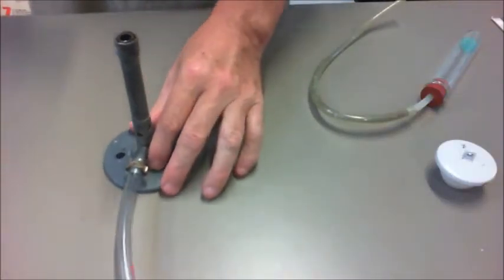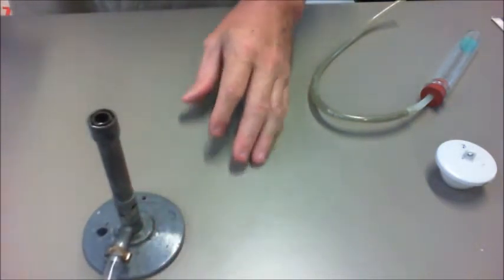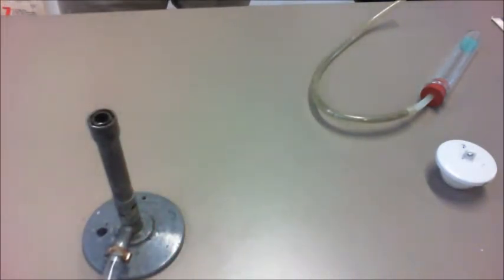Welcome to the experiment today, which is an example of a decomposition reaction. A decomposition reaction involves the breaking down of a particular material.